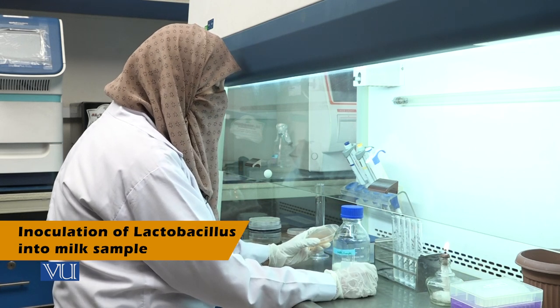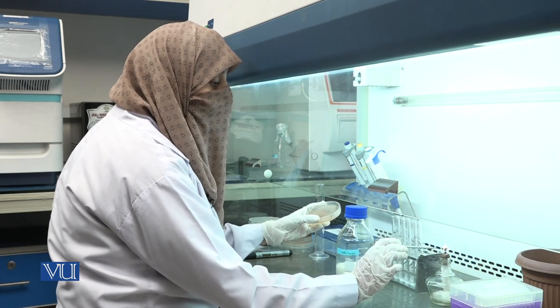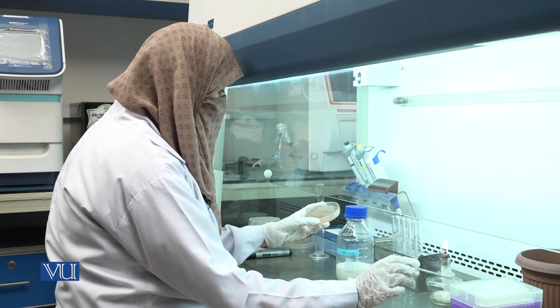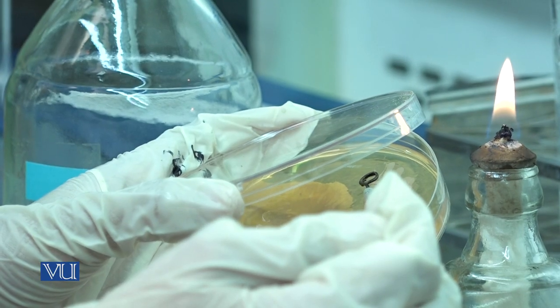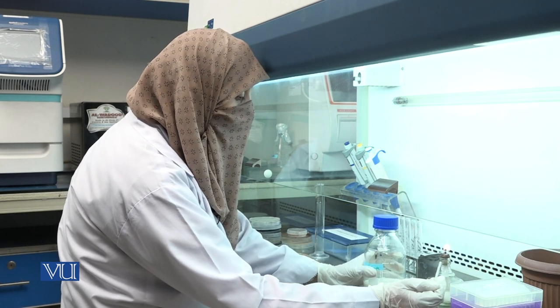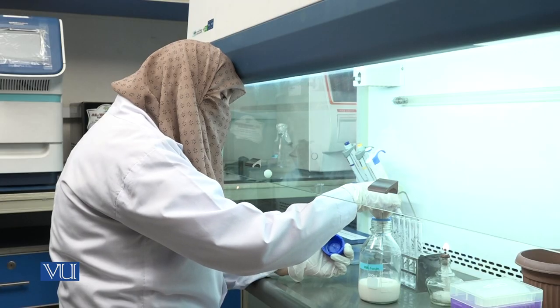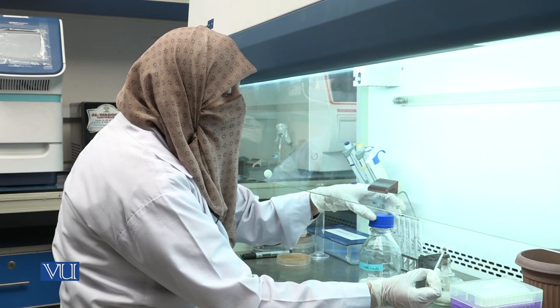This is the Lactobacillus strain, isolated and identified. Flame the inoculating loop to red hot and allow it to cool for 1-2 minutes. Now take a single colony of Lactobacillus and inoculate the milk sample with the help of the inoculating loop. After inoculation, flame the loop red hot again.